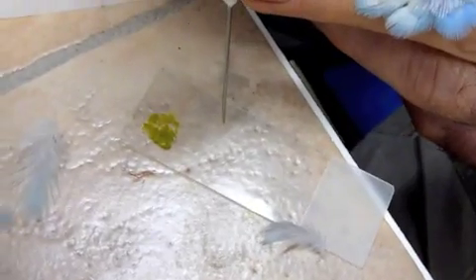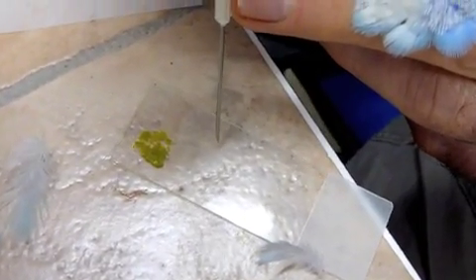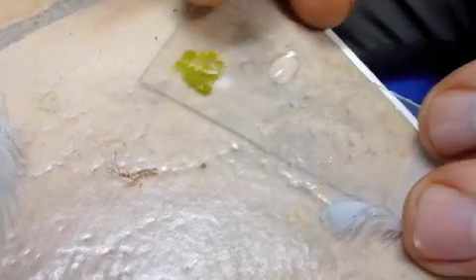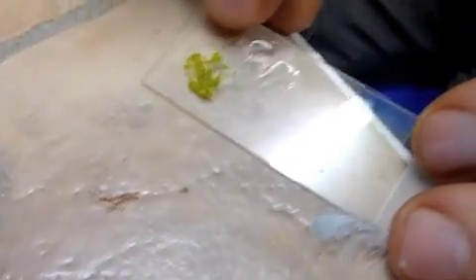Or he may have disease. I'm now adding a drop of saline or sterile water — either will do the job — just to the slide, and we'll get that to run in under there. Then we'll make the smear thin; that smear as it is there is far too thick.